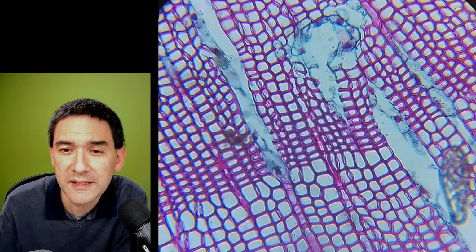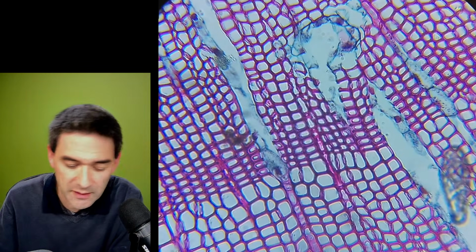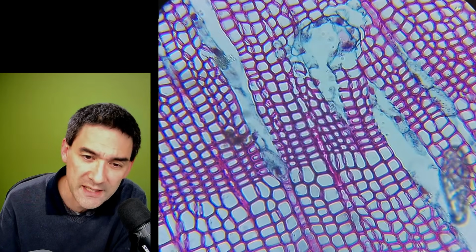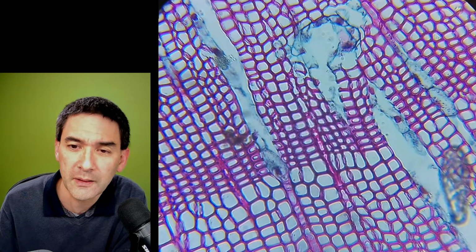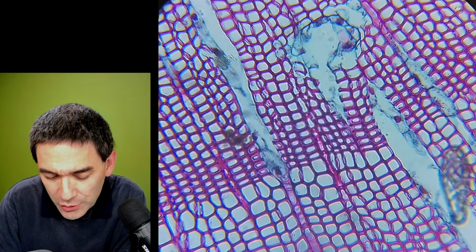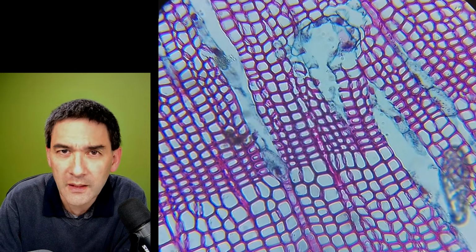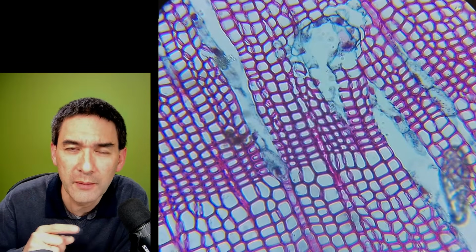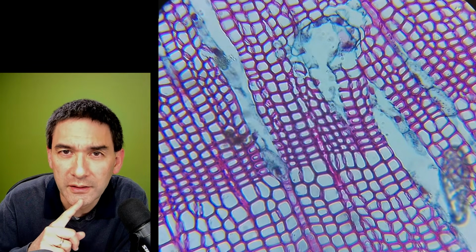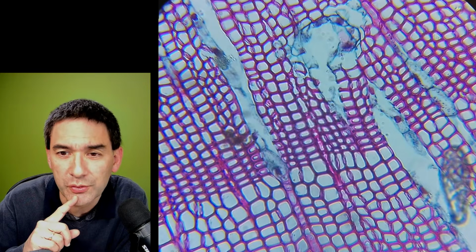So is this the Telmoscope? No, it's not. This one actually is also not made anymore. It's a Swift SS110, and this one is actually also several years old already. The Swift SS110, and if you Google for it, in my other microscopy channel called Microbehunter, I actually also presented this microscope once.